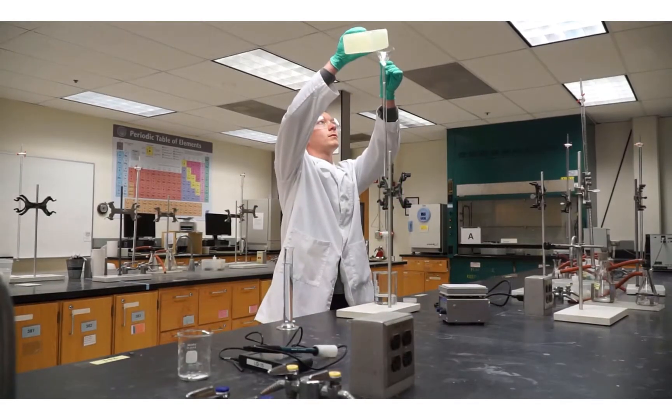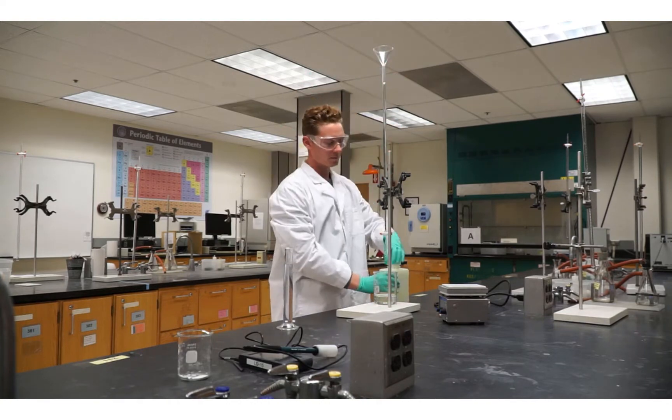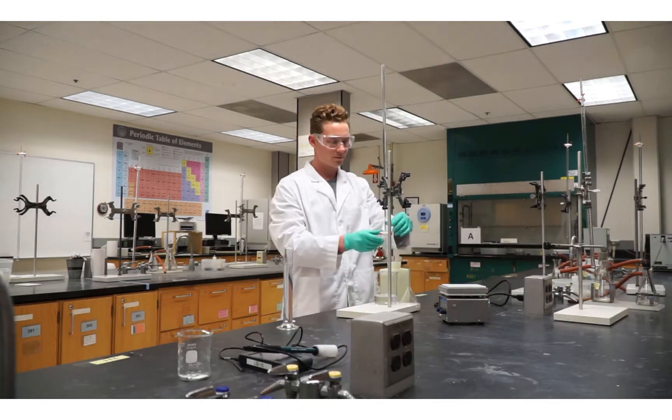The titrant you are using is your standardized HCl solution. Fill the burette with the solution and prep the burette.